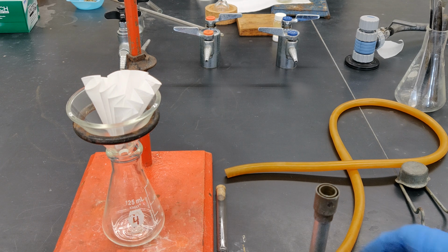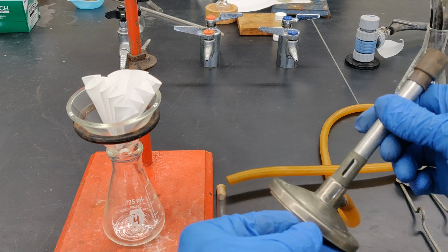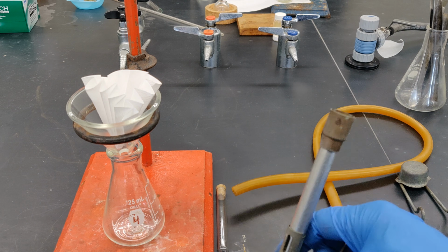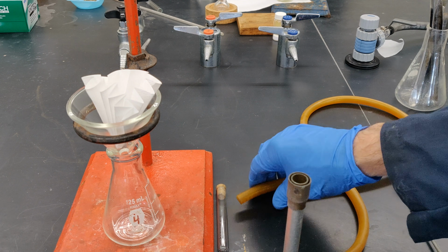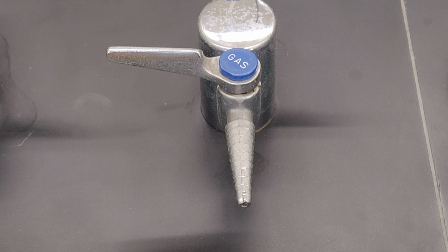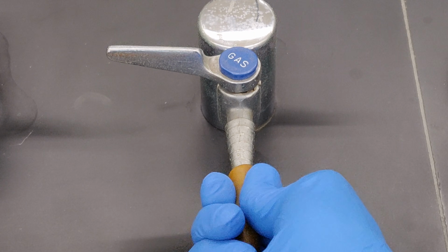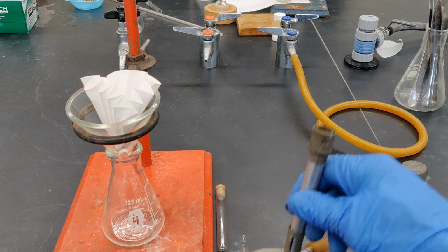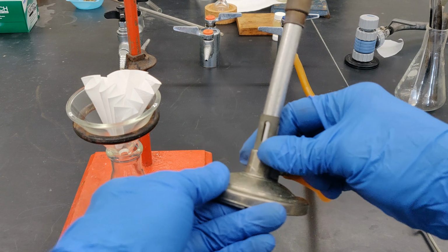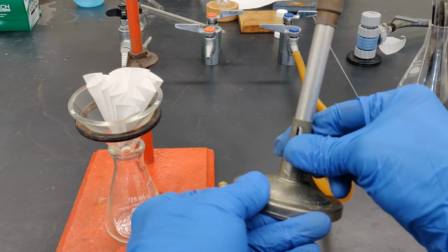At this point, light a Bunsen burner, and note that it's only because you're using a non-flammable solvent, water, for recrystallization that you're using a flame for your heat source. To light the burner, the thin-walled tubing that's attached to the burner must be connected to the nozzle of a gas tap. Make sure you're connecting it to a gas tap and not a tap for either air or steam, which may look similar to a gas tap. Partially open the burner intake window to admit air.